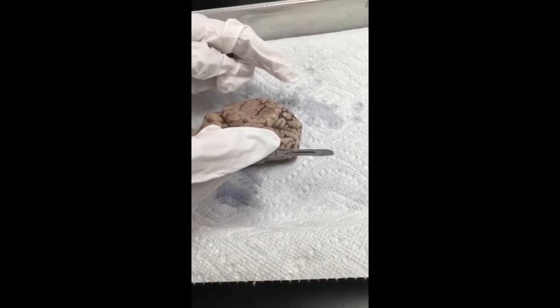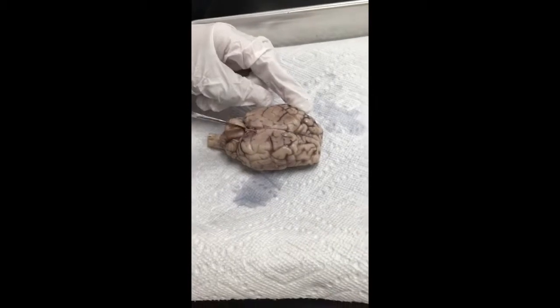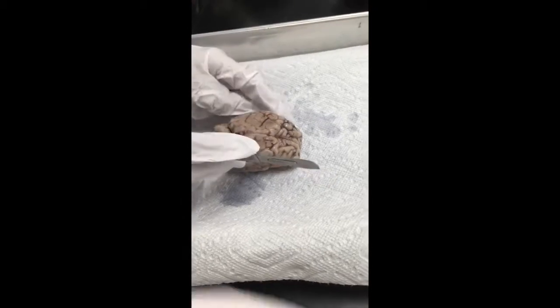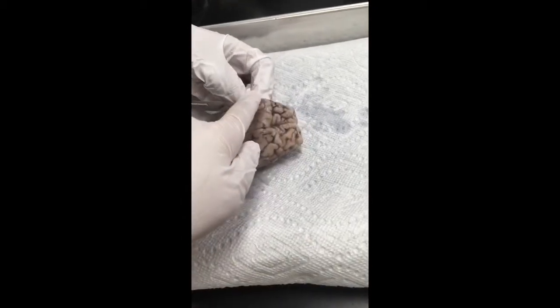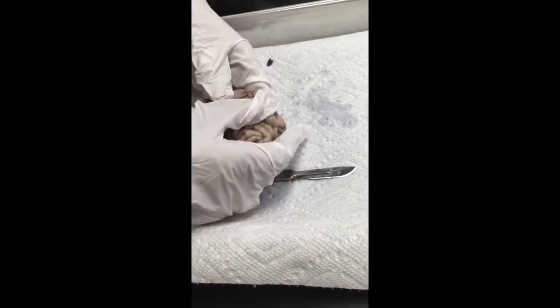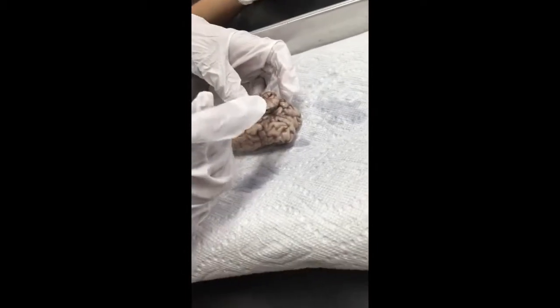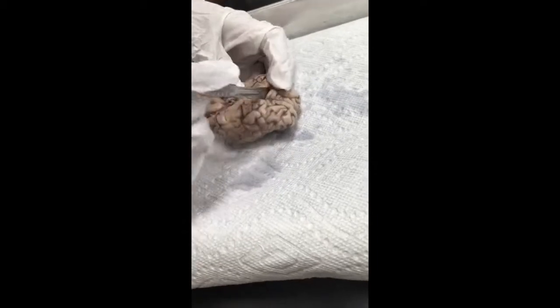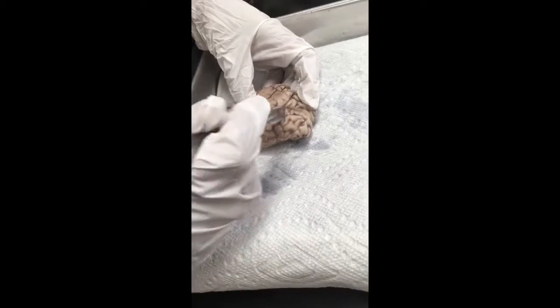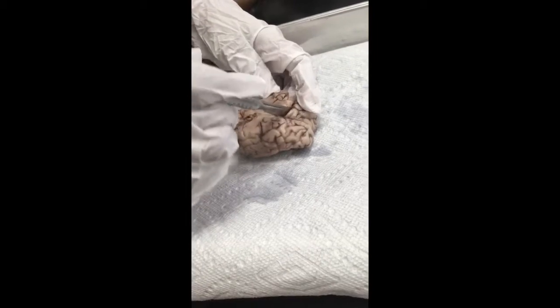So the central sulcus, where is it? It's between, now, that's the longitudinal fissure. The central sulcus is between the parietal and the frontal. The parietal and frontal. Let's see. That's the temporal, by the way. Parietal. This is it. That one. You see? Look at that. That's the central sulcus. Is not that nice? Central sulcus. All right.